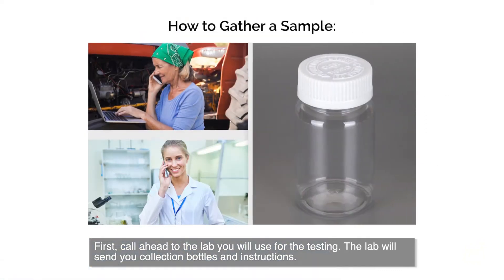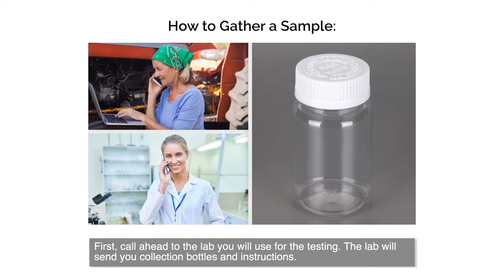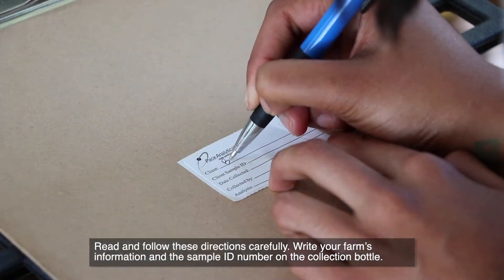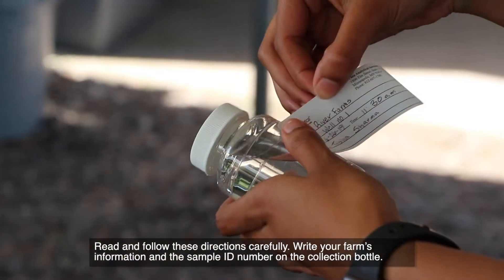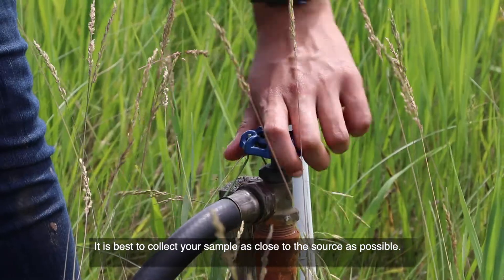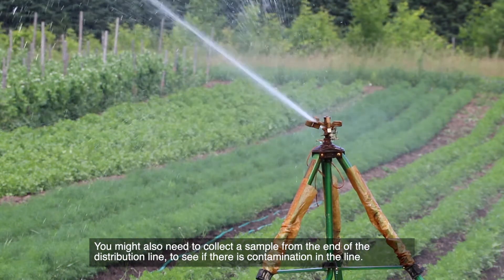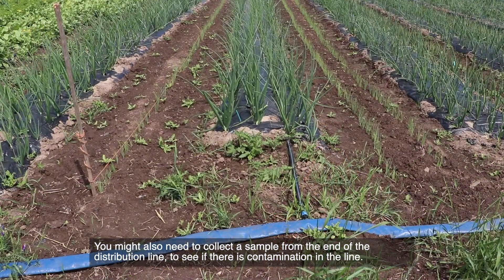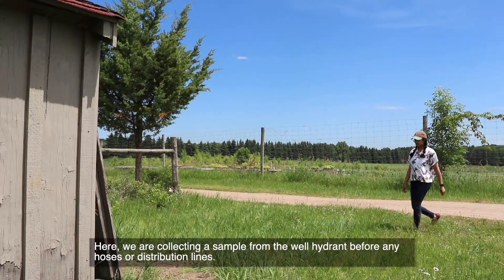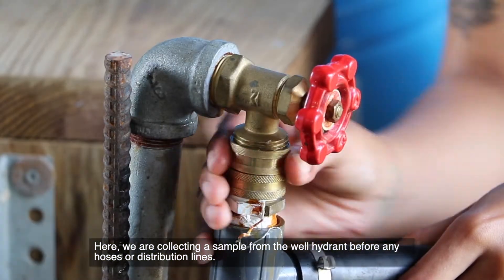First, call ahead to the lab you will use for the testing. The lab will send you collection bottles and instructions. Read and follow these directions carefully. Write your farm's information and the sample ID number on the collection bottle. It is best to collect your sample as close to the source as possible. You might also need to collect a sample from the end of the distribution line to see if there is contamination in the line. Here we are collecting a sample from the well hydrant before any hoses or distribution lines.